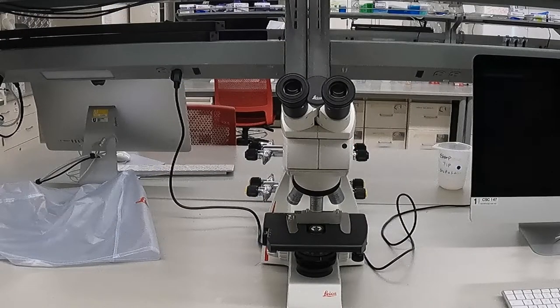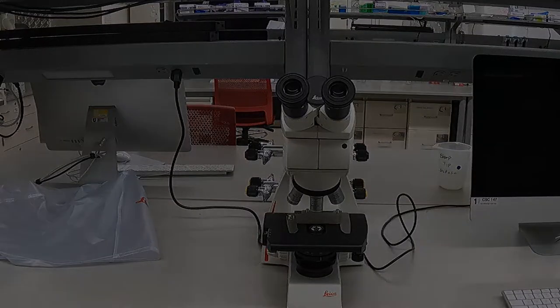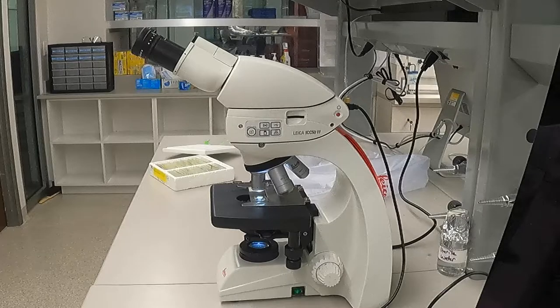While these are the basic parts of this specific microscope, different microscope models can have variations on the exact location and types of features present. Now that we know the basic components, let's walk through how a microscope can be used to view a sample.